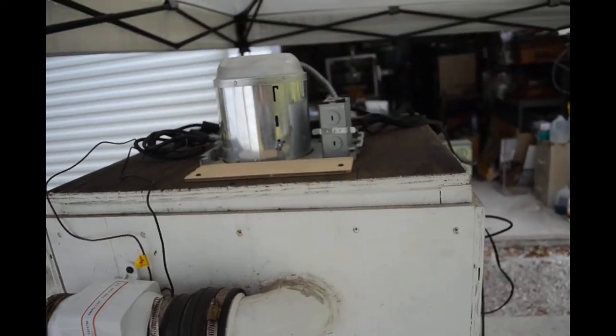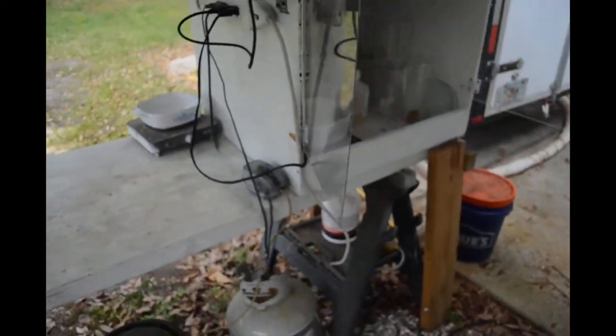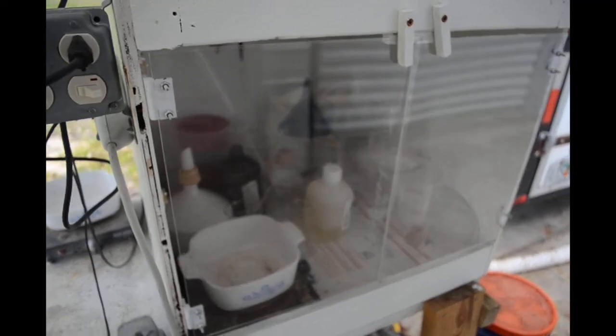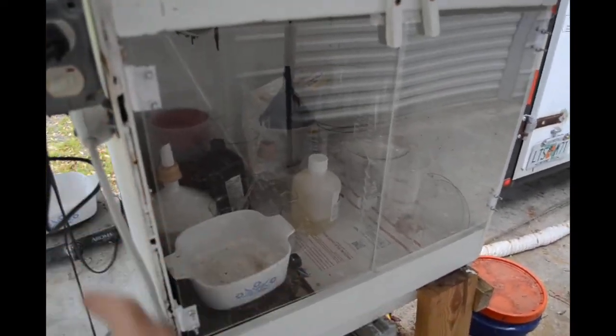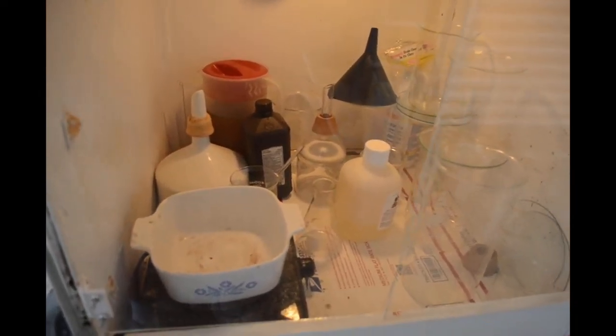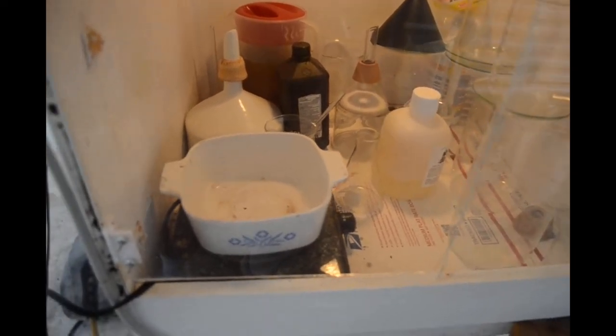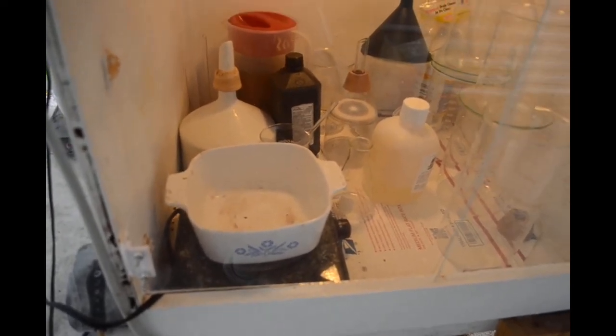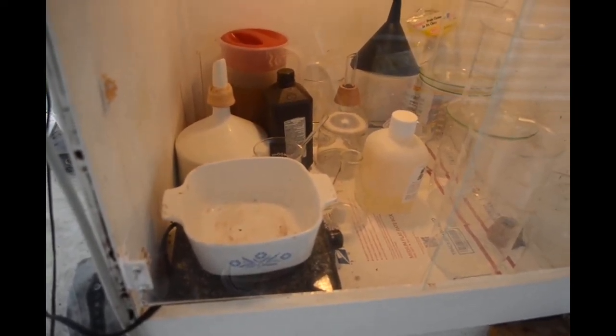I think I'll box in all this stuff up on top just to make it a little neater but the fume hood is just working really really well. I'm pretty happy with it. I think this will be better for you guys when I'm filming because these nice clean door panes are nice and transparent now and with the light on the inside won't have to deal so much with reflections.